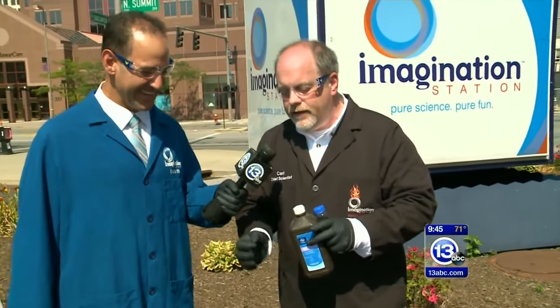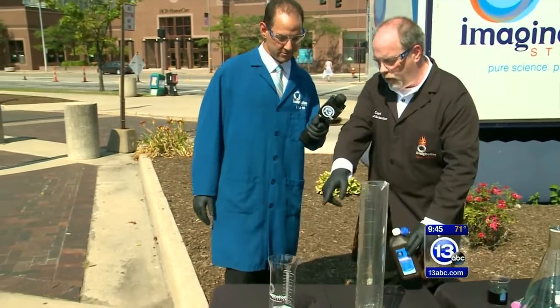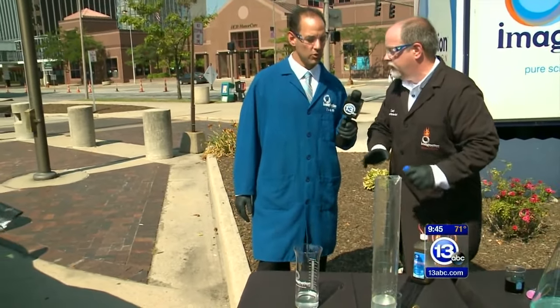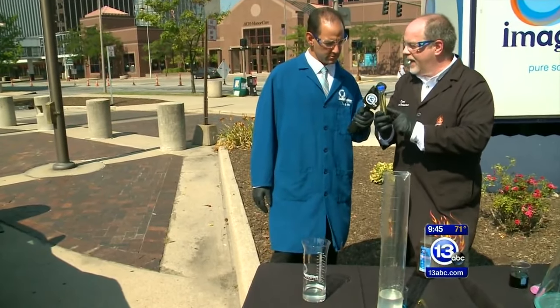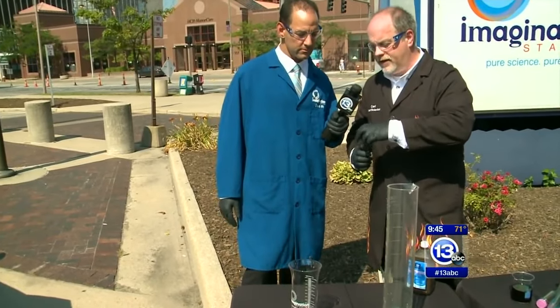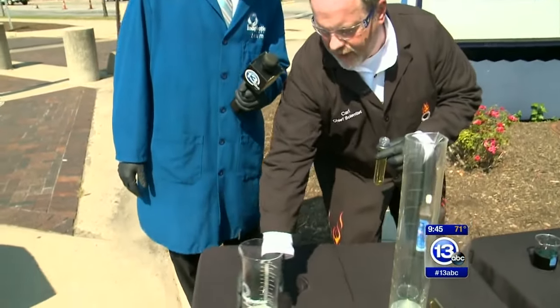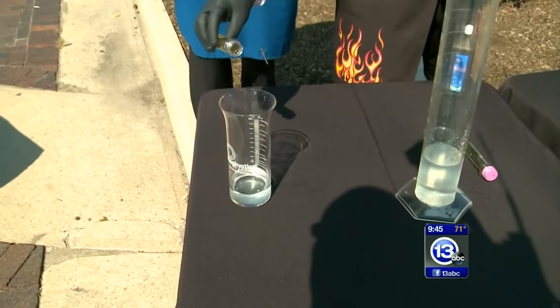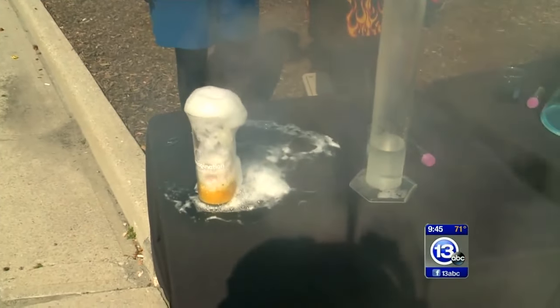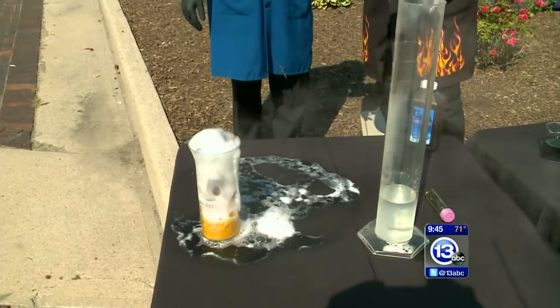Let me show you what happens here. So this is just a bigger scale version. This here is 3% hydrogen peroxide. What we're using over here is 35%, so it's much more concentrated. I have a catalyst in here, sodium iodide, and we're going to pour that into the hydrogen peroxide just to see what happens, because it should catalyze it and cause it to break down. Step back. Whoa. Catalyzed all over. And look at that steam — this is an exothermic reaction. We're generating heat. We generated lots of oxygen gas there.